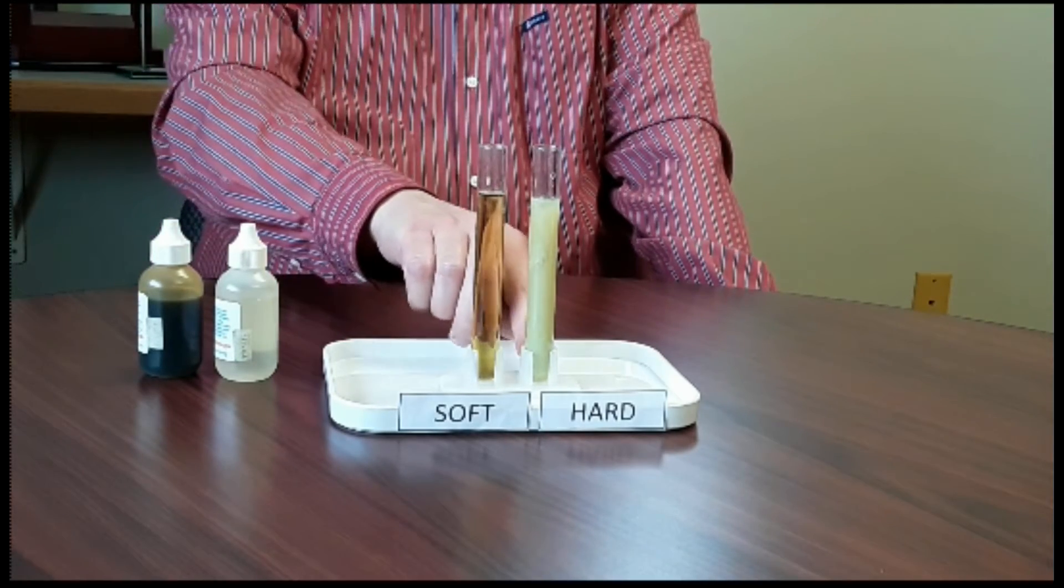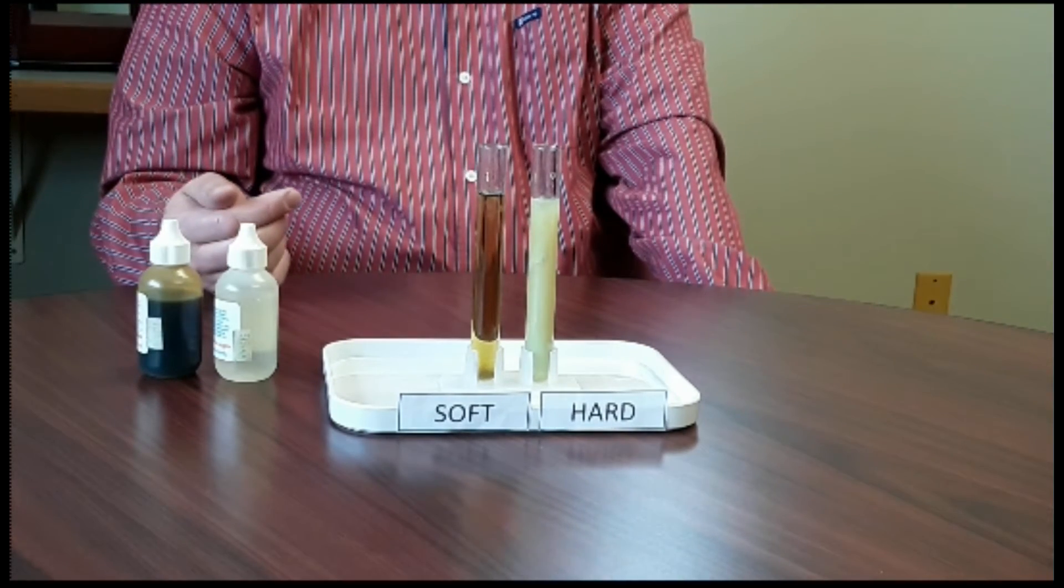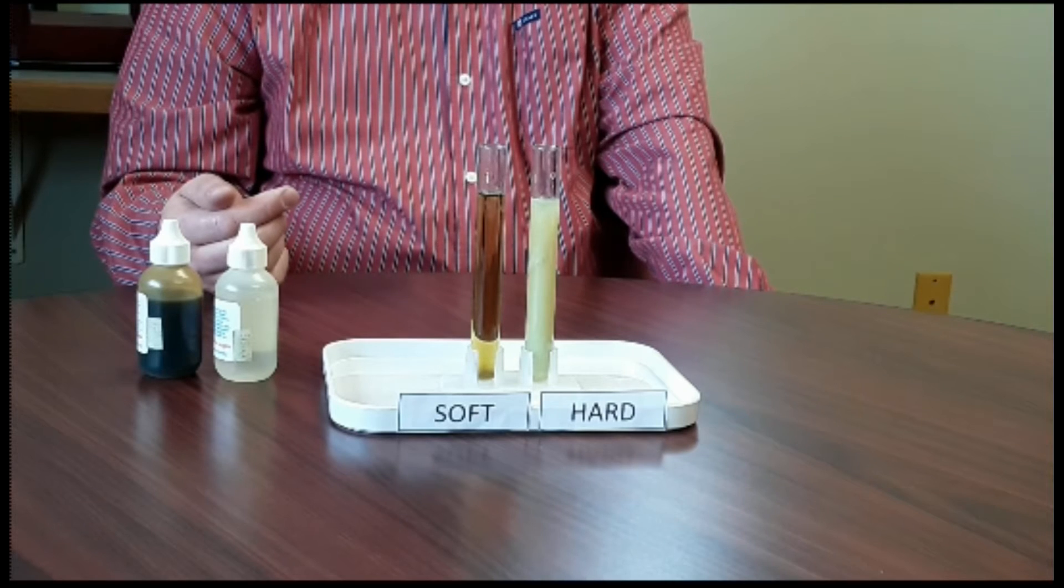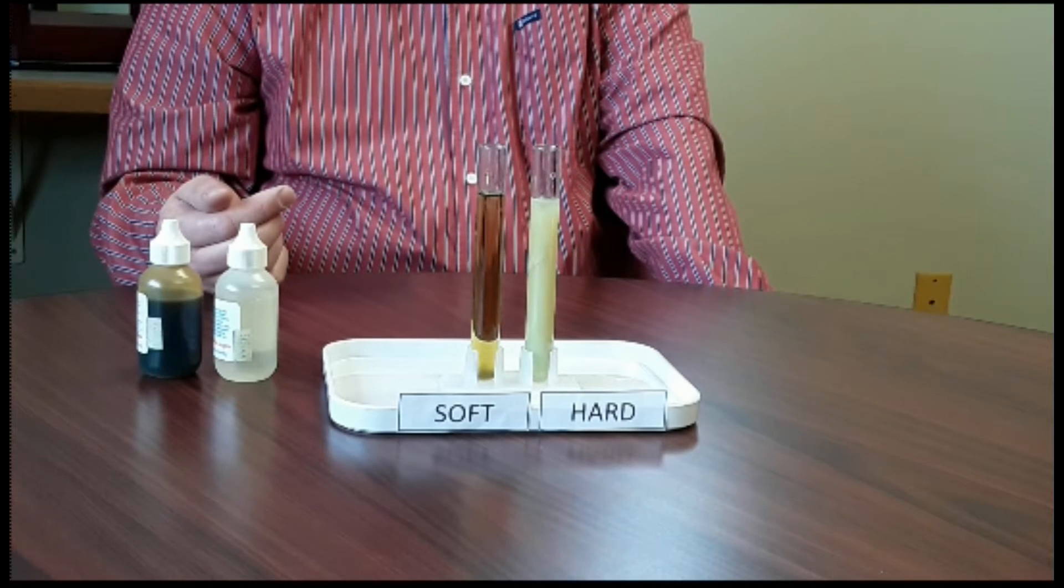You can see how cloudy it is on the hard water. That's the buildup you're seeing on fixtures, faucets, shower heads, and giving you trouble in your dishwasher and washing machine.